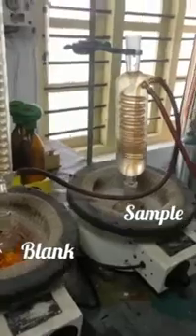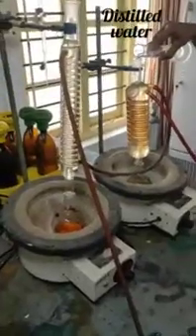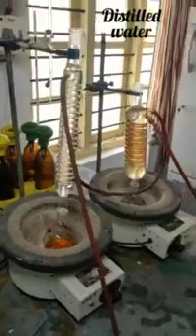Apply heat and reflux for 2 hours. After refluxing, cool and wash down the condenser with 90 ml distilled water.